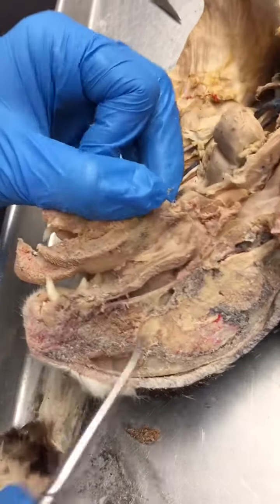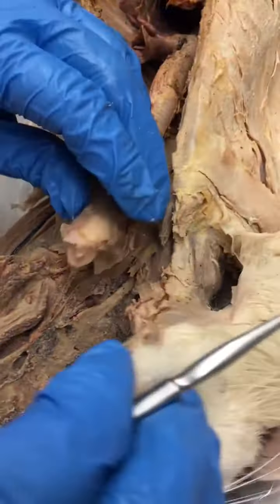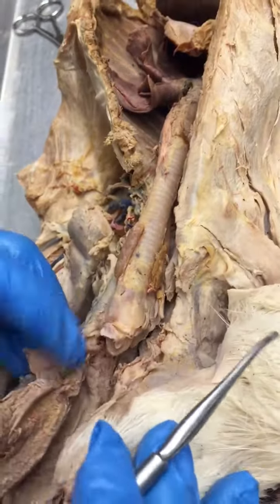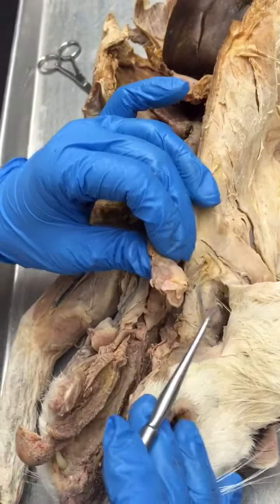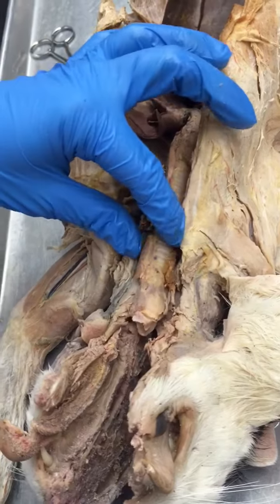We had to dissect the larynx out before we cut the head in half so that we wouldn't damage the larynx, but we'll do the larynx next.